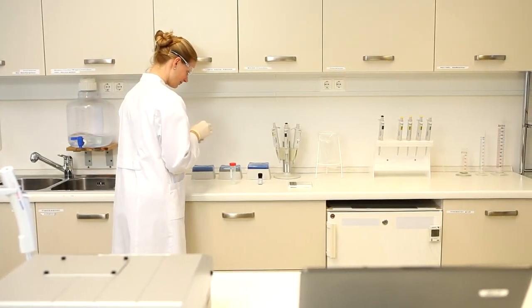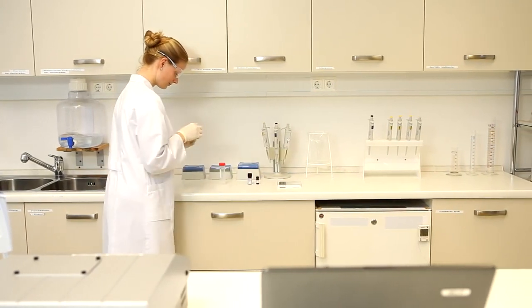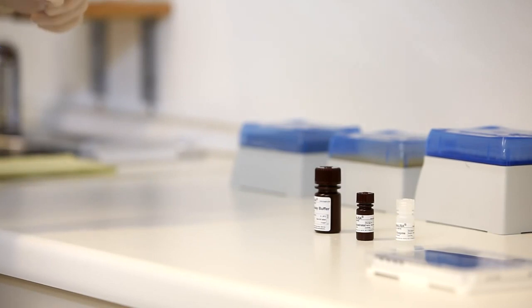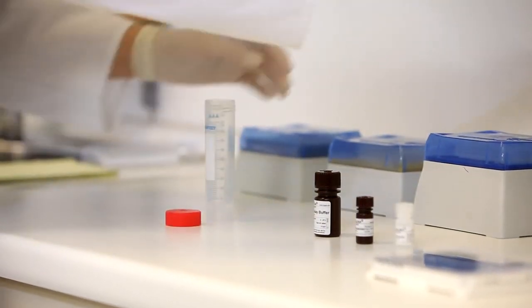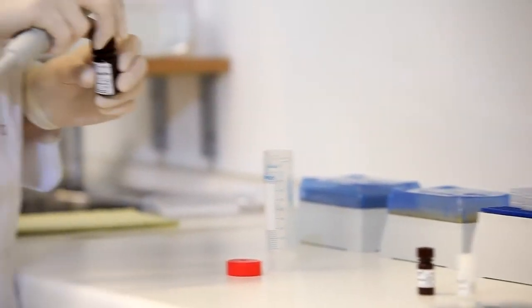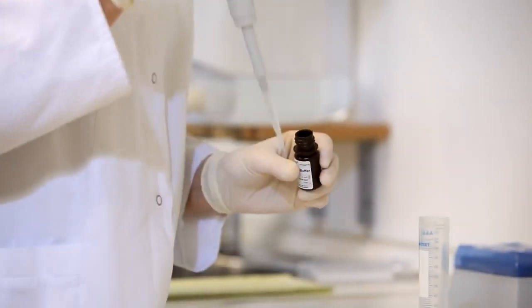The endotoxin can now be detected. Prepare the required amount of assay reagent using the substrate, enzyme, and assay buffer.